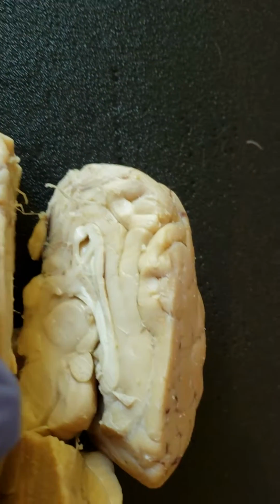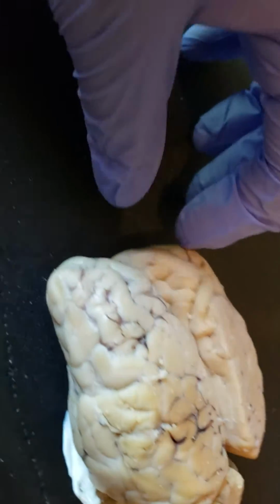So I'm going to pull up real quick the list of things to go over. Here's that. So, start off, I cut the thing in half, just because I thought it'd be easier, obviously, when you're looking at the inner brain structures. I even cut the cerebellum in half to make it easier to look at the white matter and such. But, yeah, we got a lot to go into, so I'm going to start it off.